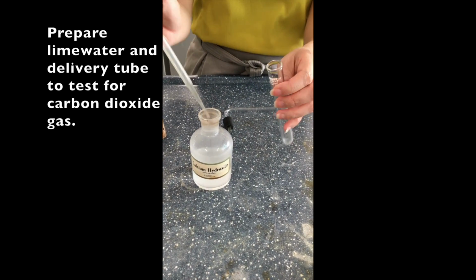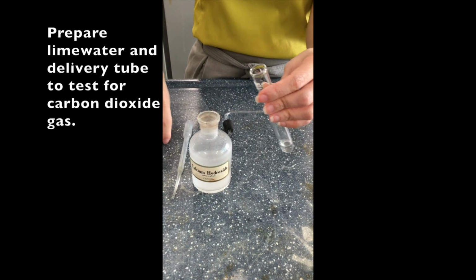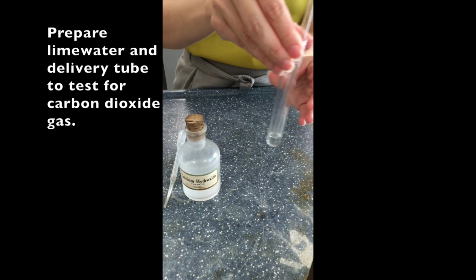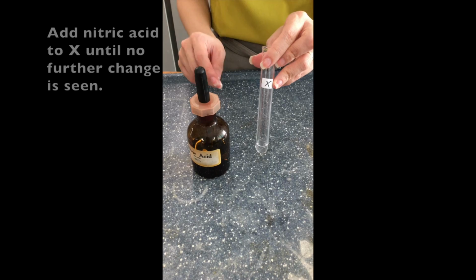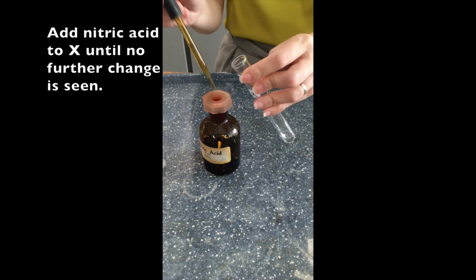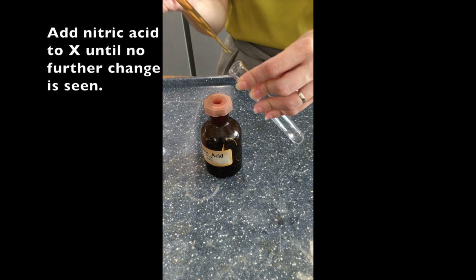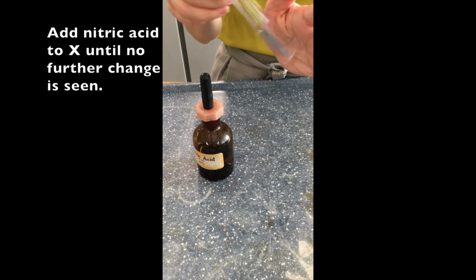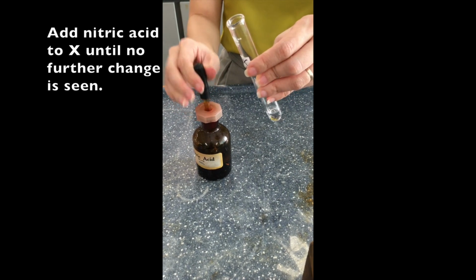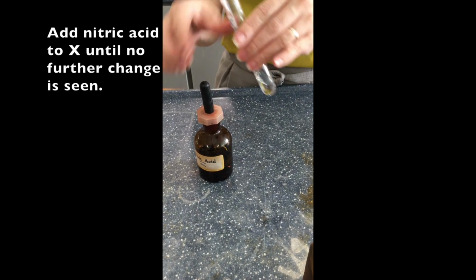Now we prepare our lime water and delivery tube just in case carbon dioxide gas is produced. So we start with adding nitric acid to X until no further change is seen. So how do you know if a gas is produced? You have to look out for any bubbles or effervescence. So it seems like there is no visible change, but we have to add until no further change.